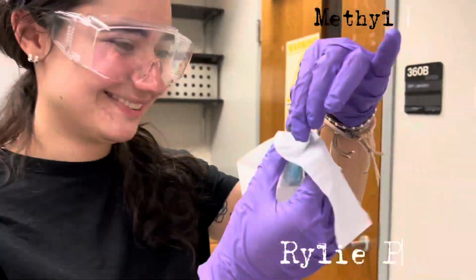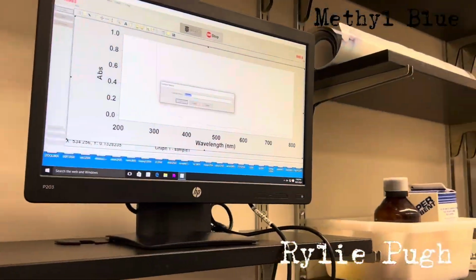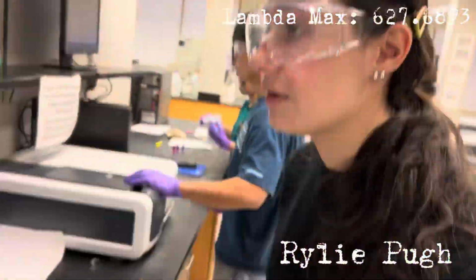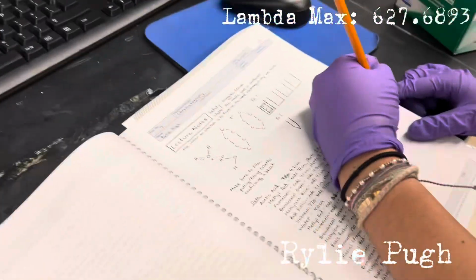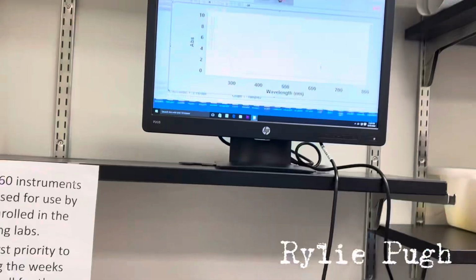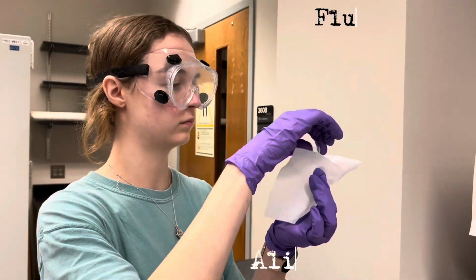When scanning across all wavelengths, the spectrum shows various peaks where absorption or emission occurs. The highest peak in the spectrum corresponds to the lambda max, which shows where the substance absorbs the most light. 2 examples of why we would scan across all wavelengths are chemical analysis and materials, because scanning across all wavelengths allows us to identify an unknown substance or the concentration of the substance, and finding the materials helps us analyze the optimal properties of these materials.